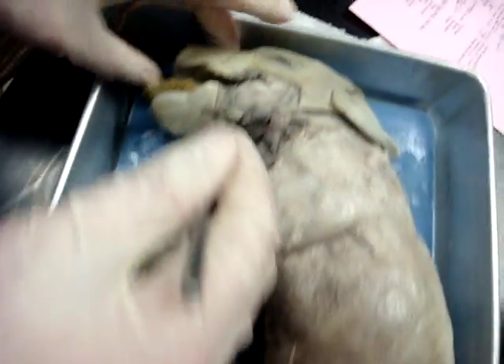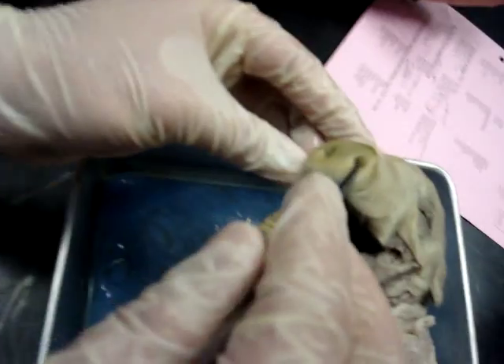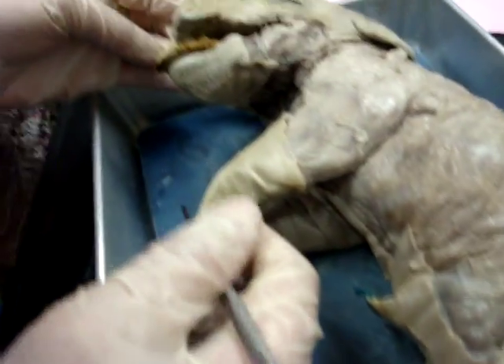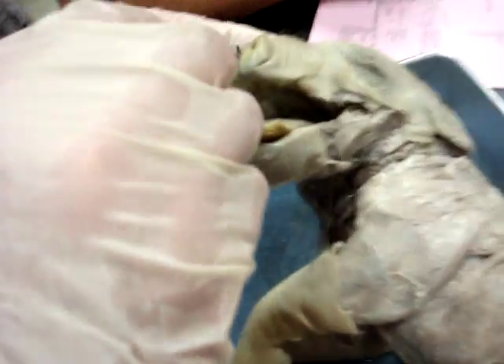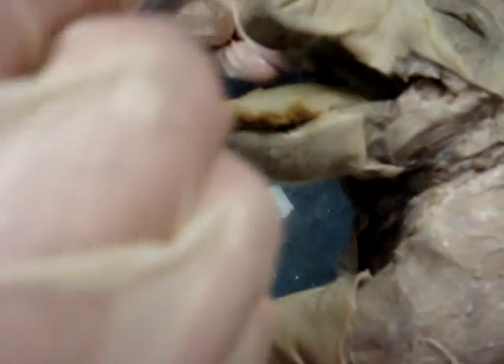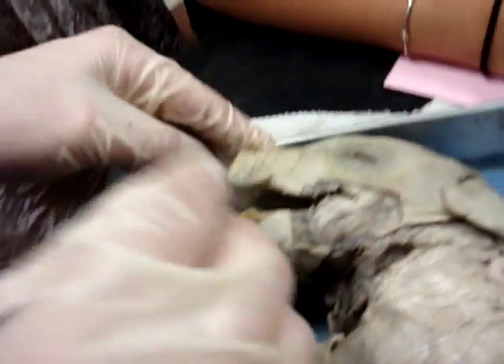Show me your nasal. Like nostril, you mean? Yes, nostril, thank you. Show me your vibrissae. The vibrissae are the hairs on the snout — not there. Oh, it's these? Up by the nose on either side. So it's around the snout. Oh, okay.